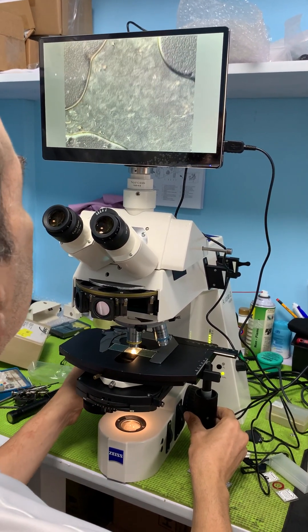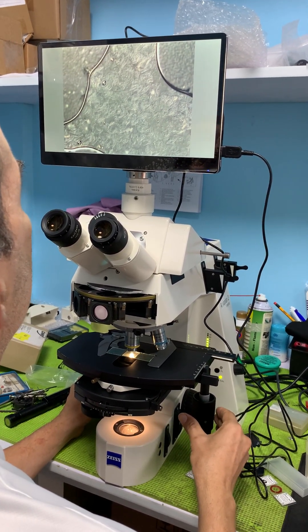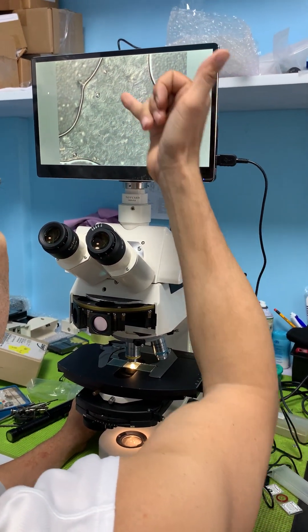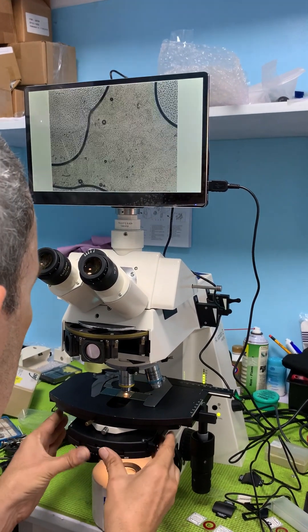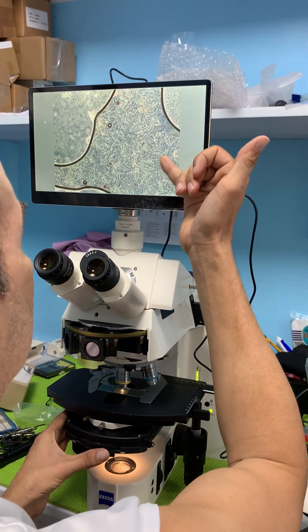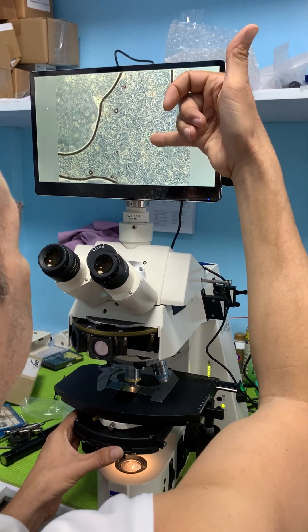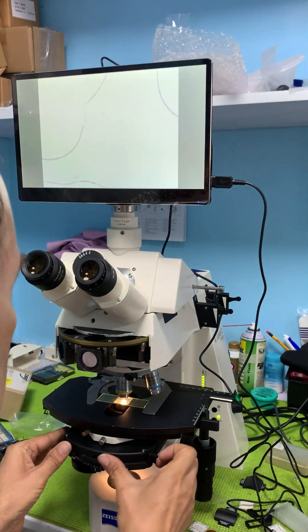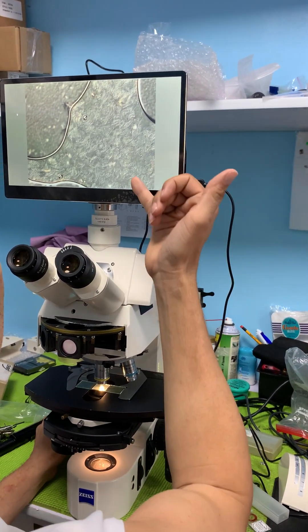They're out of focus for a moment — now I can see very good detail. Every one of these is a cell. Now switching to phase: with phase I don't see nearly as much detail. I do see a nucleus, but not the finest details — just more of an outline. With DIC, you get really fine details.